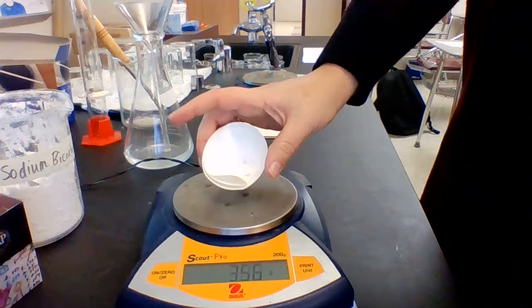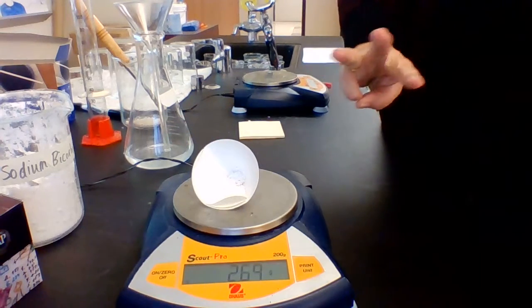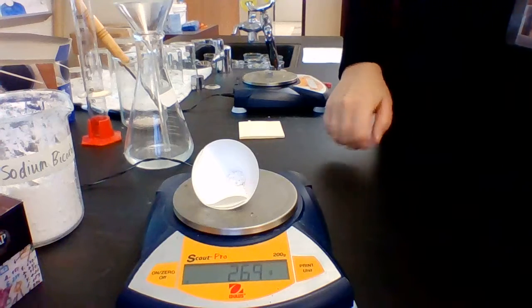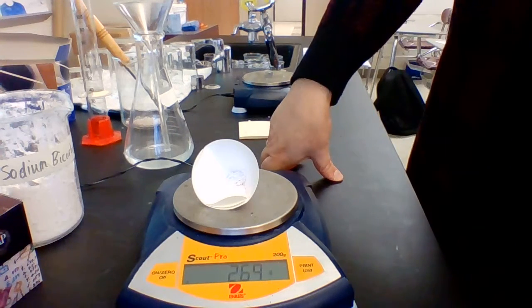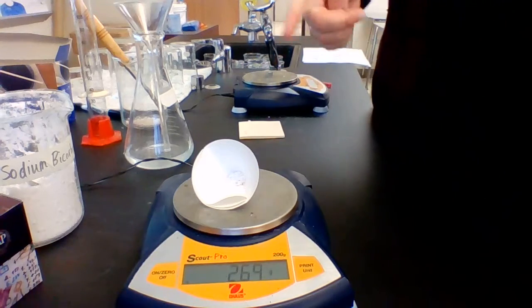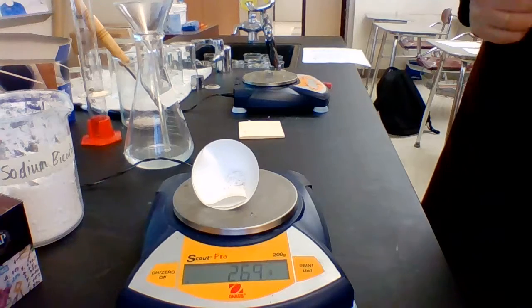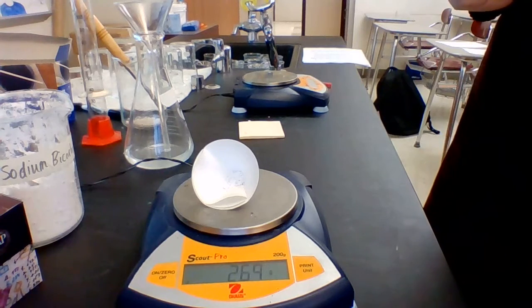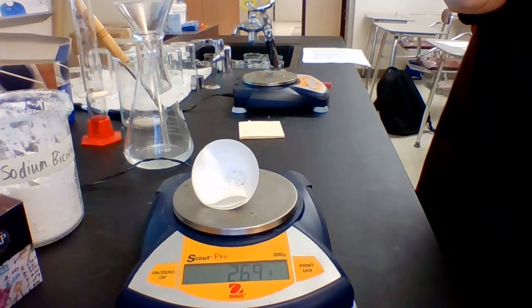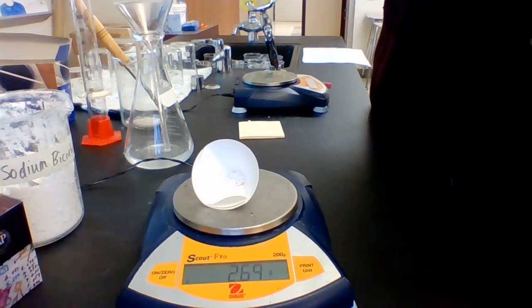So by elimination, we can figure out that this is calcium carbonate because we have four substances from this reaction. The four substances were calcium carbonate, sodium chloride, water, and carbon dioxide. We know it's not carbon dioxide because carbon dioxide is a gas. We know it's not water because water is a liquid. The reason we know it's not sodium chloride is because sodium chloride dissolves. So it would not have collected itself like this. Sodium chloride would have been dissolved in the water and it would have gone through the filter paper.